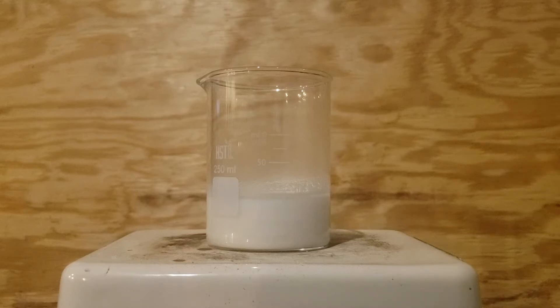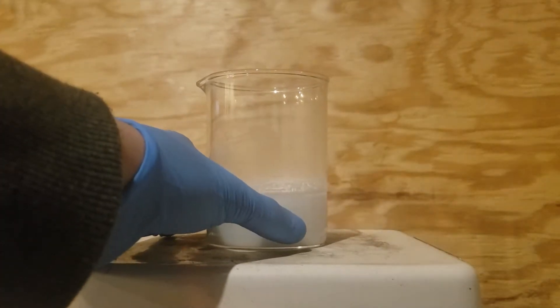Hello and welcome back to another video. Today is going to be a little bit of a different one. I'm going to be synthesizing boric acid from sodium tetraborate.